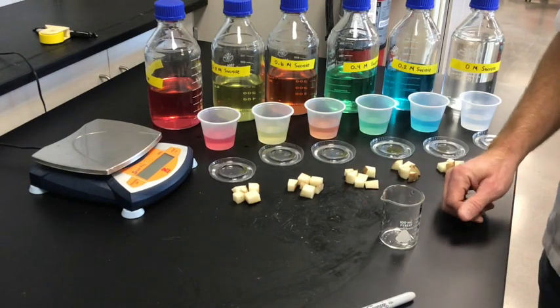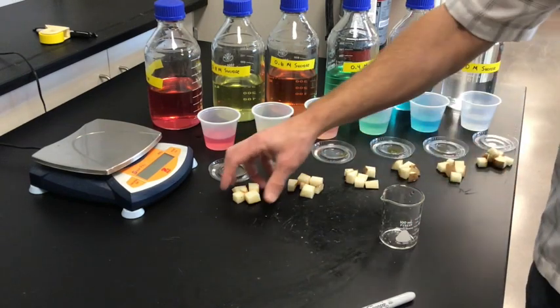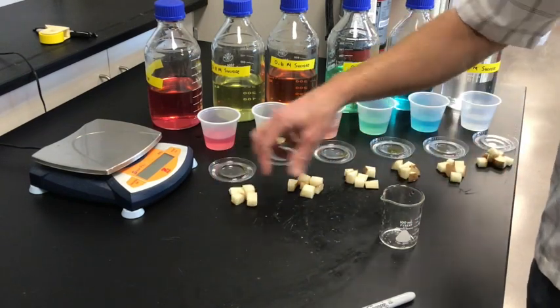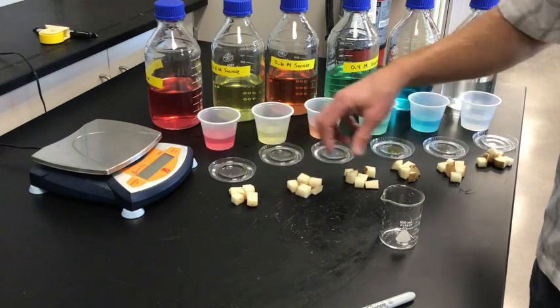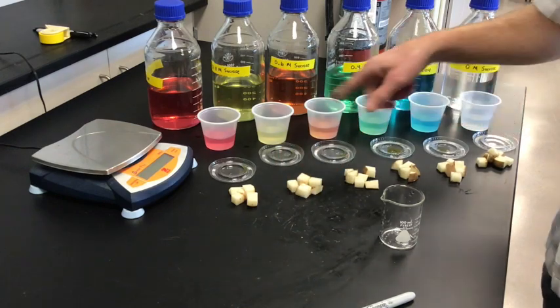The next step is going to be weighing the groups of potato chunks and writing the weight down on the cup.